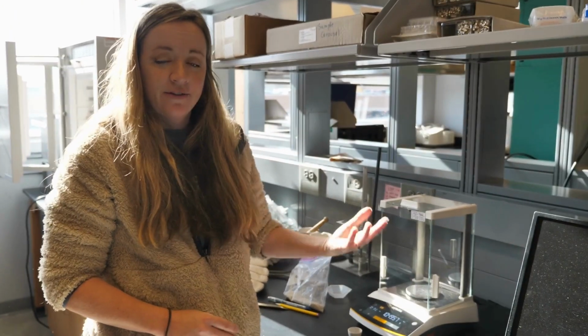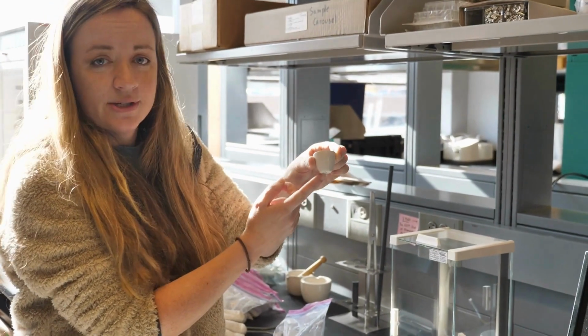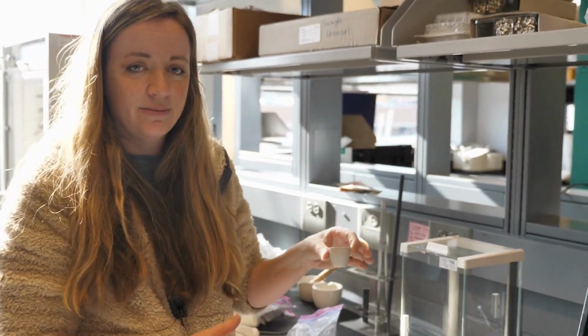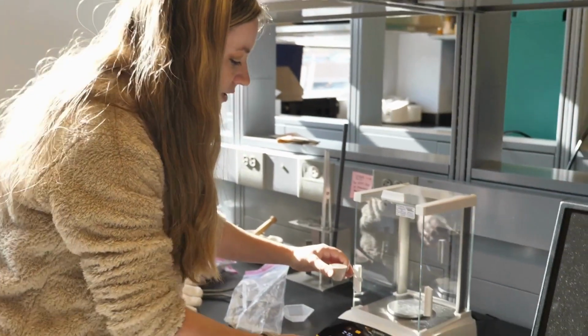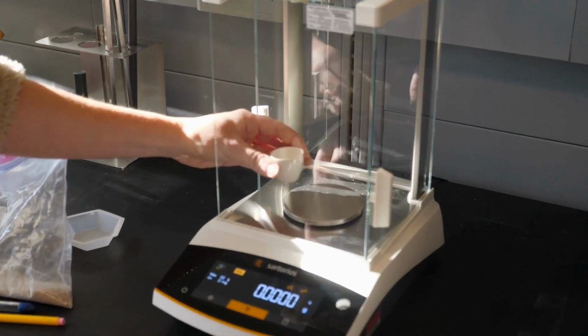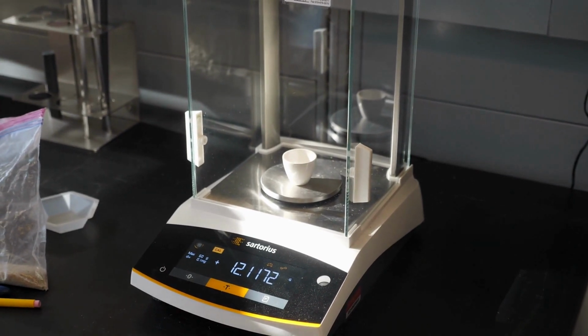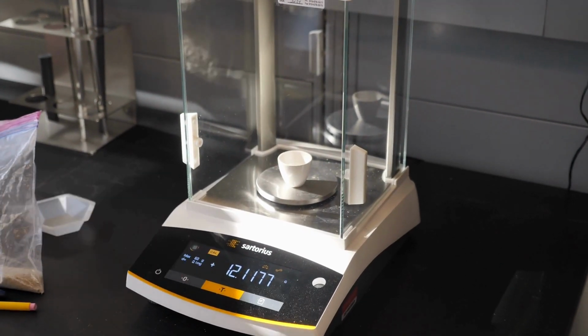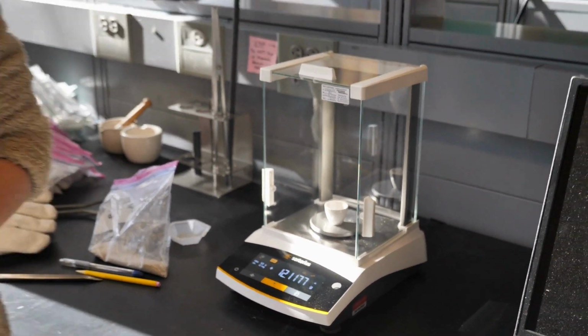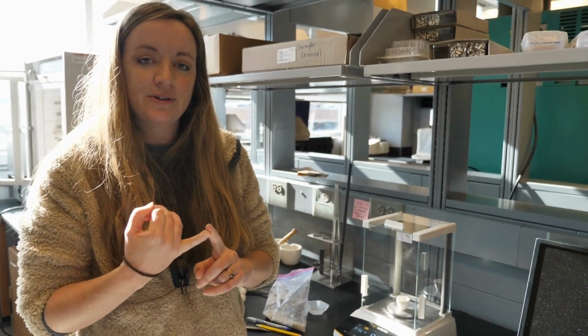After you've taken your samples out of the oven and they're cool enough to the touch, you'll need to re-weigh them once again. So again, make sure that you're taking note of the crucible ID, as you should have written that down earlier to correspond with your sample ID. You'll zero out or tare your scale and weigh the post-ignition weight of your sample and collect this number. Make sure that you are documenting both the empty weight of your crucible, the pre-ignition weight of your soil, and the post-ignition weight of your soil.